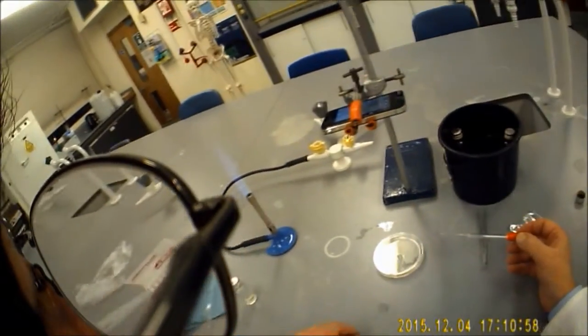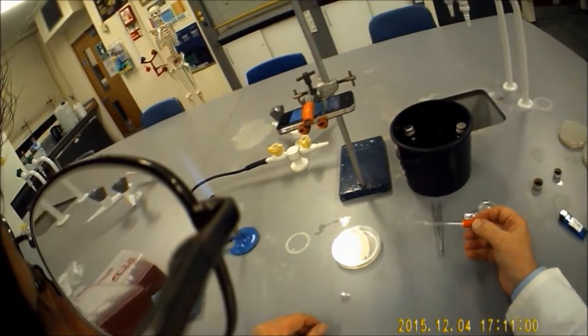Job done. It's ready for taping up and putting into the incubator. Within a couple of days we should be able to see any inhibitory effect.